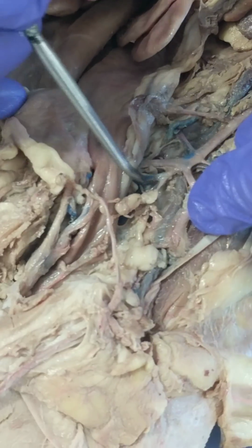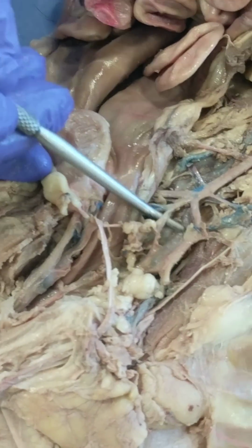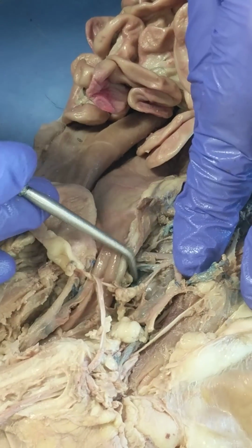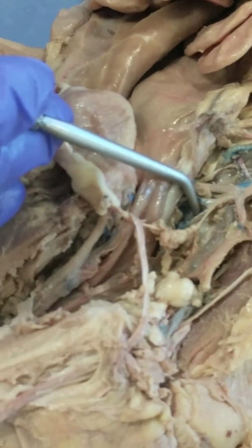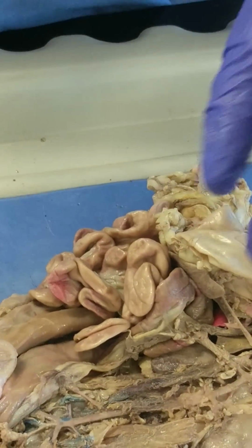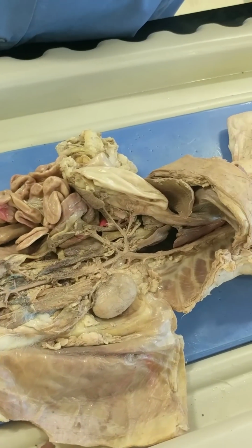And then it branches again. The aorta sort of continues. I don't really know what you call that section. Not injected is the internal iliac artery. And then here's the other one right here. There should be a caudal artery. Yeah, it's really hard to see in this cat. It's right there, it's not injected. Those are all the vessels you have to know. I think we got everything. Oh, one thing I did not mention is the membrane that lines the abdominal cavity is called the peritoneum. And that's all for the male cat.